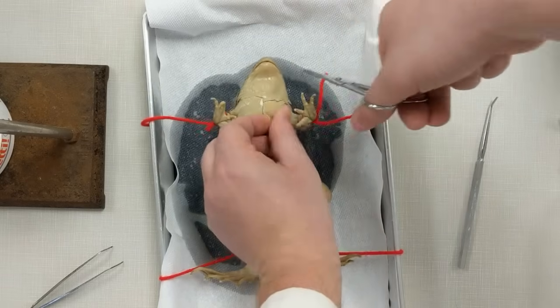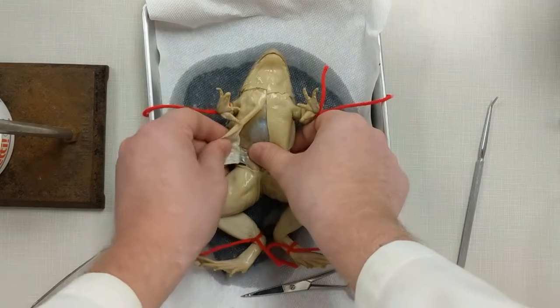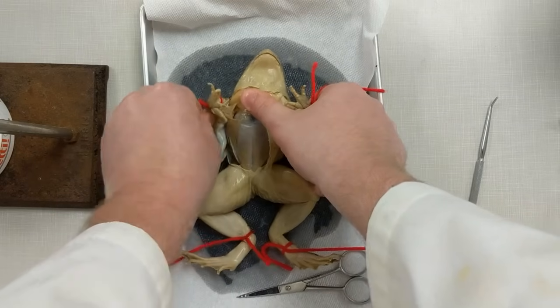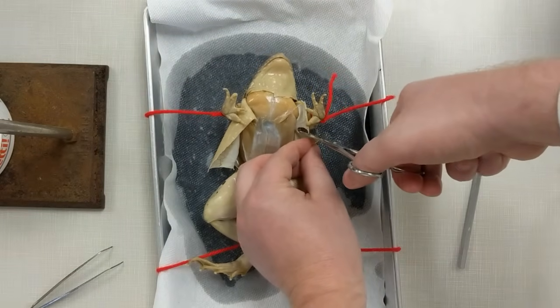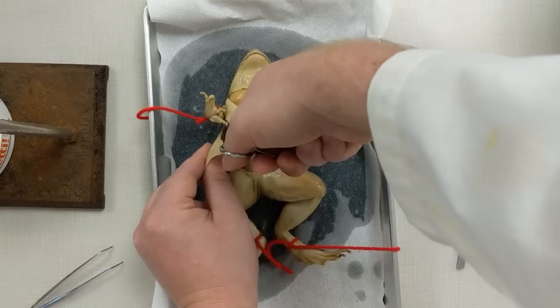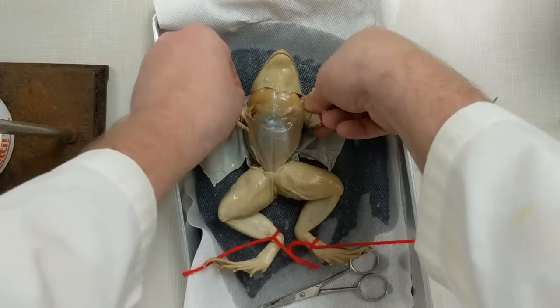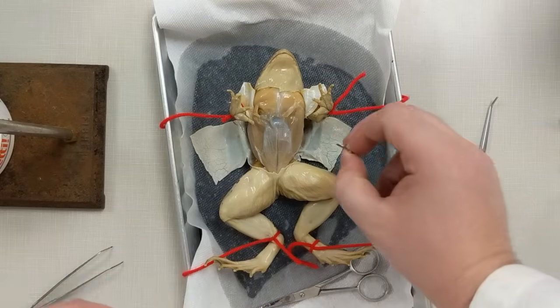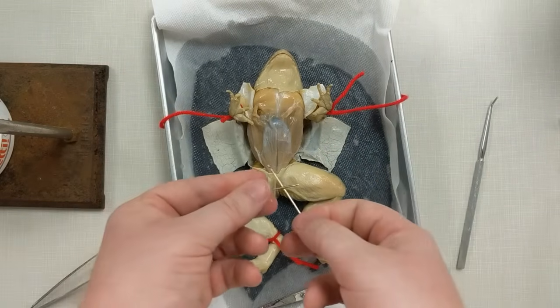Cut all the way down, then peel the skin layer back. That'll involve a little bit of tearing. You'll have a skin flap around the arm — if you want, make a cut right below each arm to get the skin to move backwards. This part can move up, and there you've got the muscle layer exposed. If your skin gets in the way, you can pin the skin down, but for the most part it shouldn't flap back up. You will need pins for the muscle, though, since it'll want to snap back to its normal position.